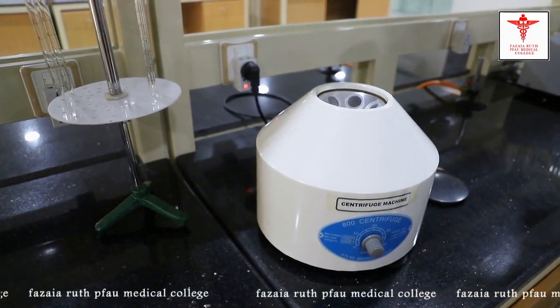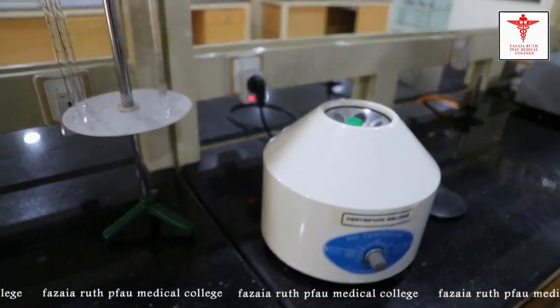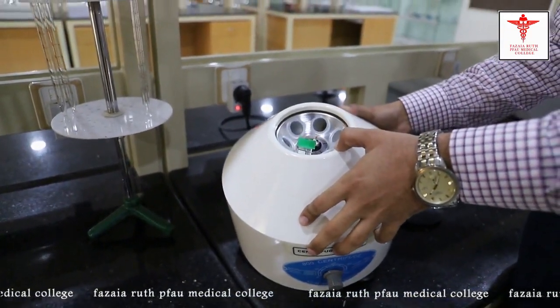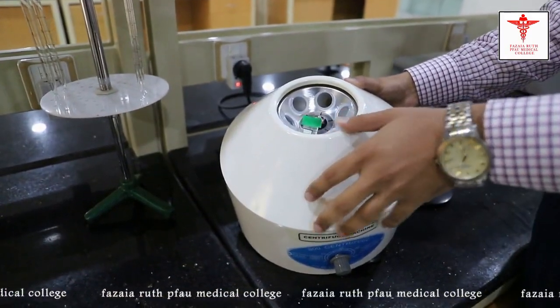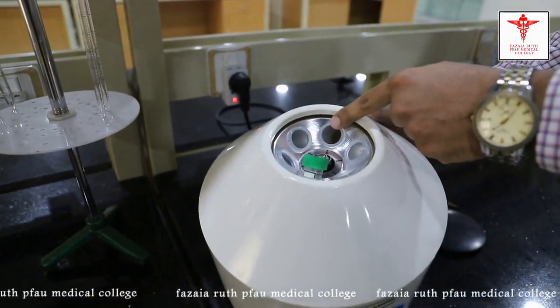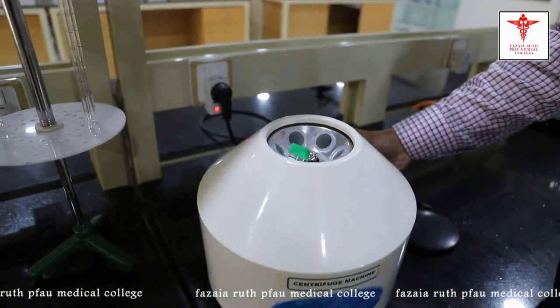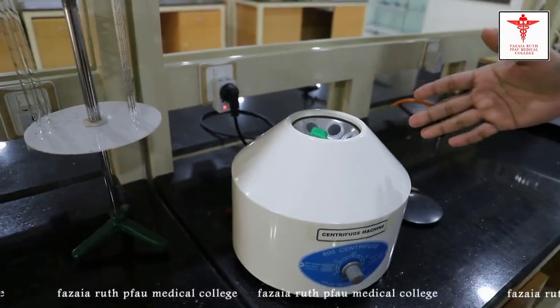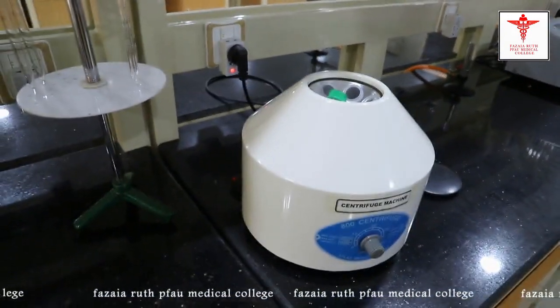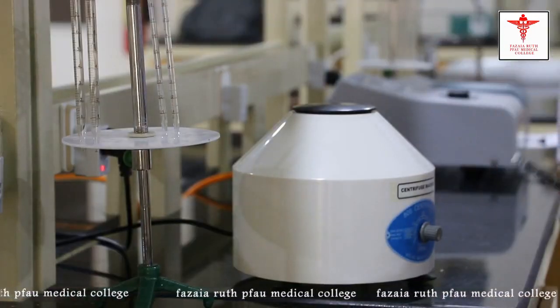We insert the tube inside the centrifuge machine. An important thing you must know is that whenever we place a sample inside the centrifuge machine, we also place a counterbalance in the slot opposite to it in order to spin it smoothly. So this is something you must remember. Now we'll centrifuge this whole blood in order to separate out the serum.